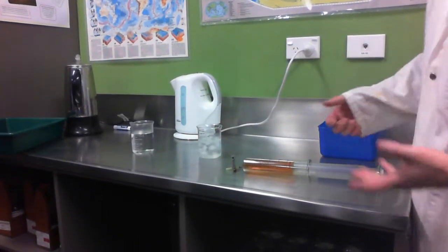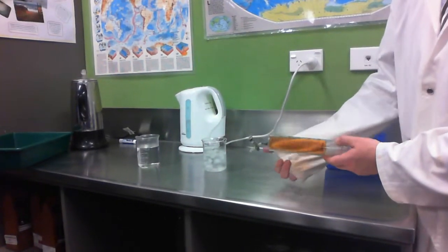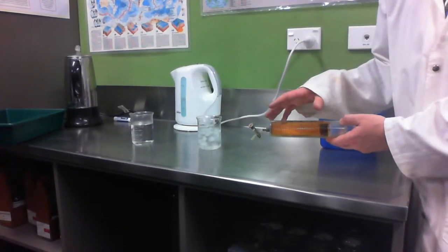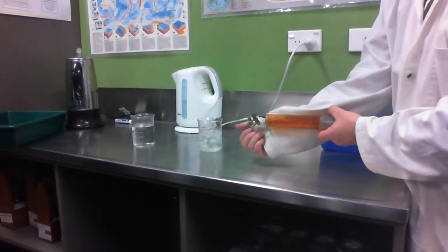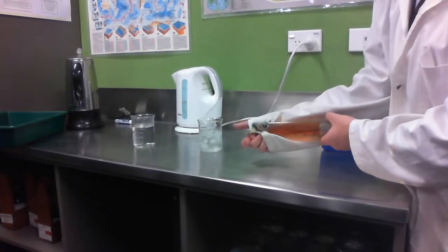Now, this is a bit hard to see because I'm not going to be able to increase the pressure a lot. And the first thing that's going to happen is the particles will get closer together. So initially it's going to go darker brown regardless if I increase the pressure. What we're trying to look for is what happens after I've increased the pressure, to see whether it changes colour again. And sometimes this is really hard to see, if at all. So I'll try and get it to work.